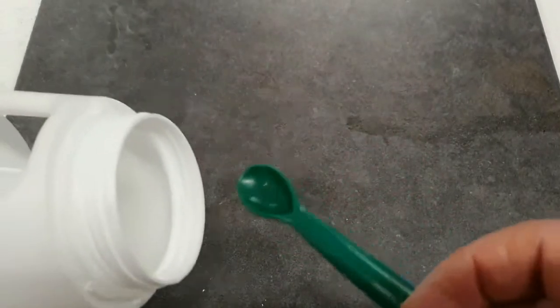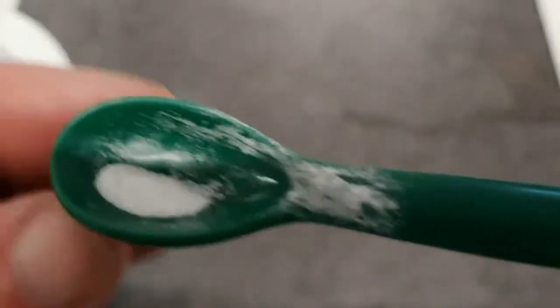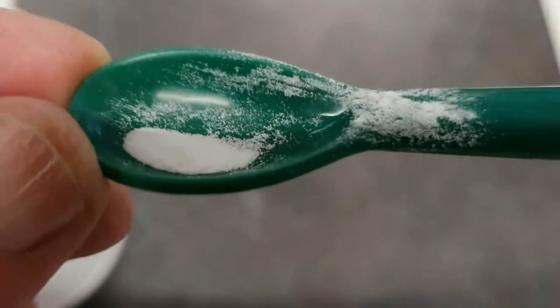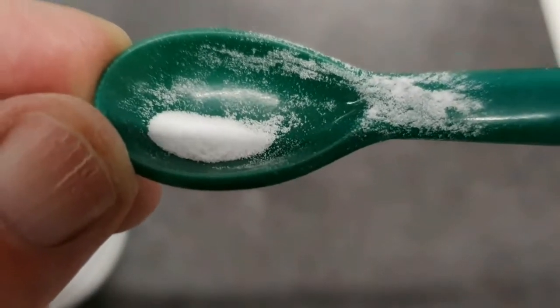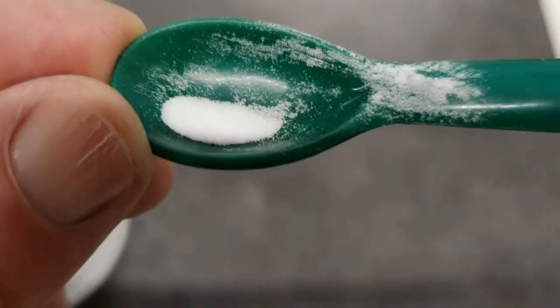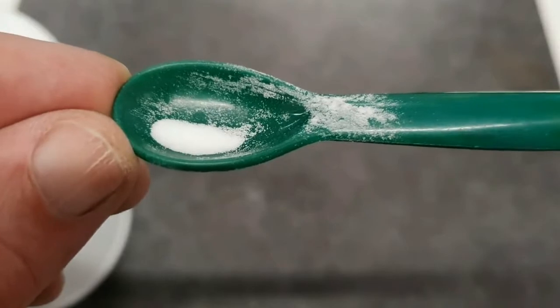So this is the calcium carbonate, and I'm using a spatula to take a sample out from the container. And when we have a look at that, the first question is the colour. Well, could I suggest white? Secondly, does it have a shine or a lustre?